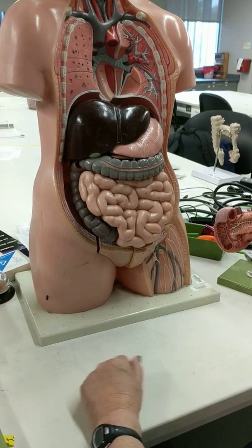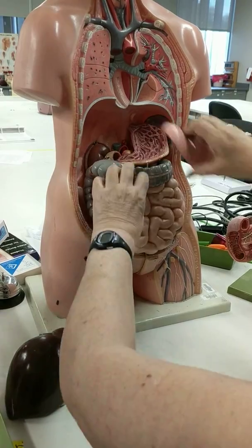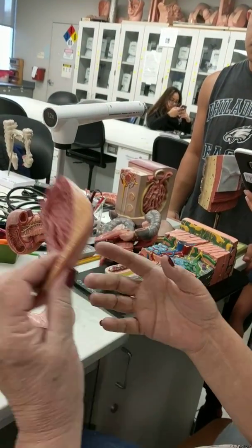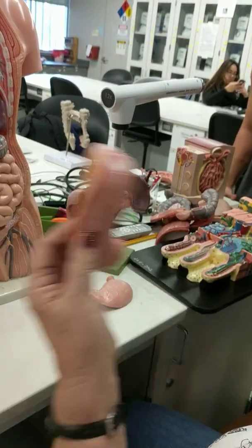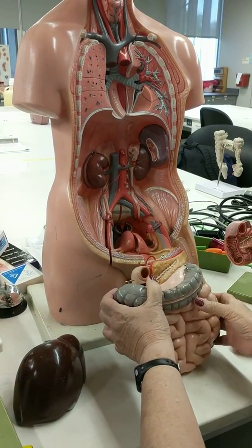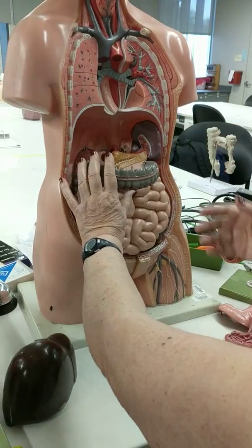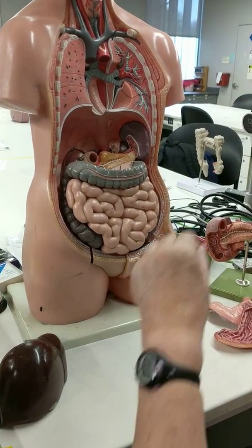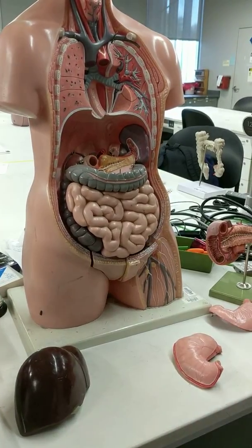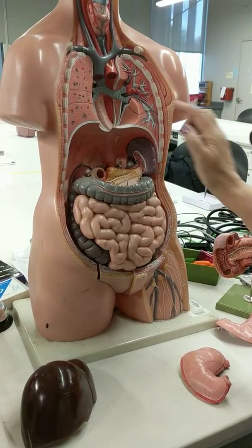Open up, mainly what you're going to see is small intestine. Here's the liver, stomach. And this stomach has what we call rugal folds, rugae, that make it bigger. Now all over this whole thing, it's going to be this big fatty layer called the greater omentum. Between the stomach and the liver is the lesser omentum, which has been cut on some of the cadavers to show you the pancreas behind. This is the pancreas. Okay.